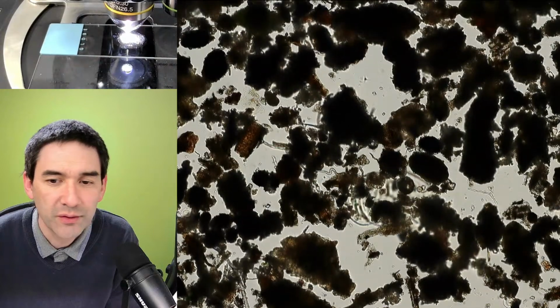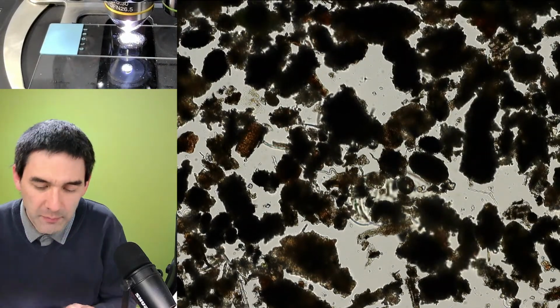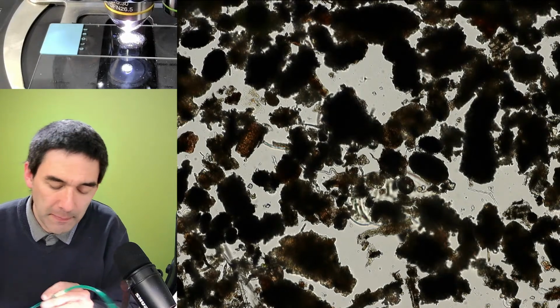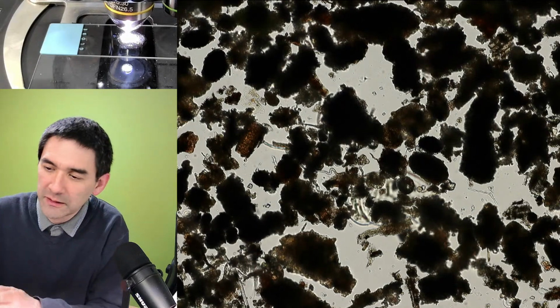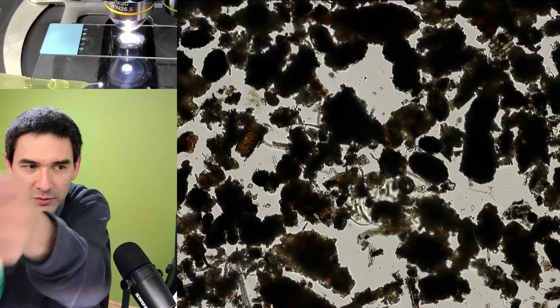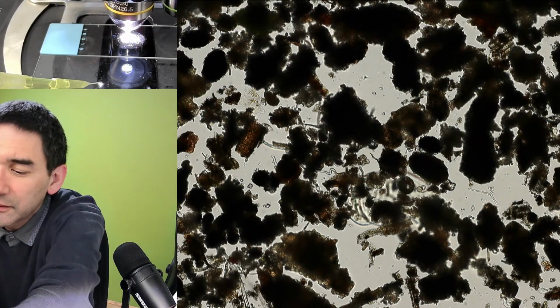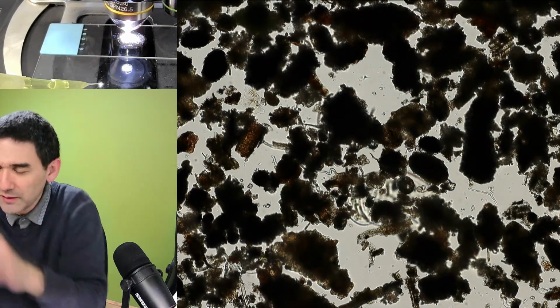So what time is it? Okay, 1:52. So basically, what I would suggest here, let's go back a little bit to the Baerman funnel. I'm struggling with the air tube here. So let's put this away. Okay, let's move it out of the way.